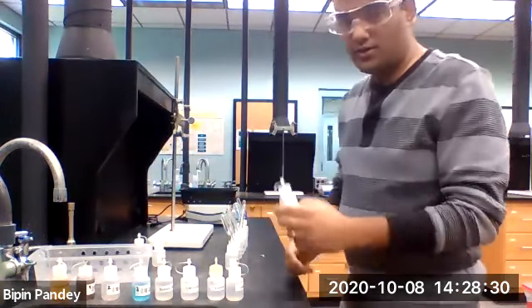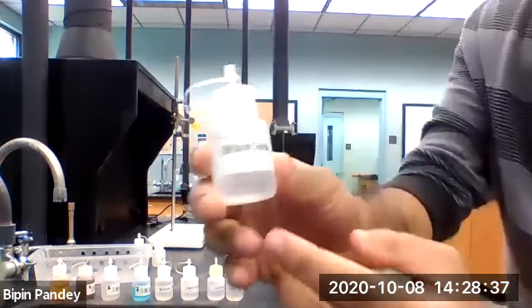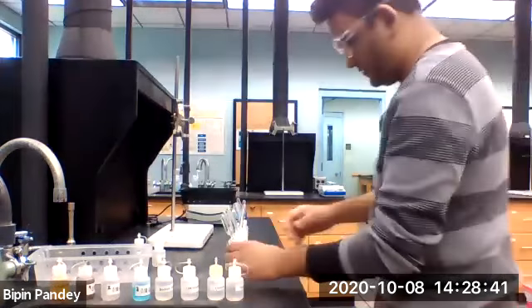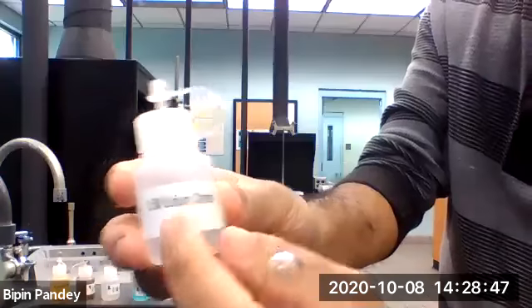I'm going to start with barium chloride. I'm going to mix it with sodium chloride.